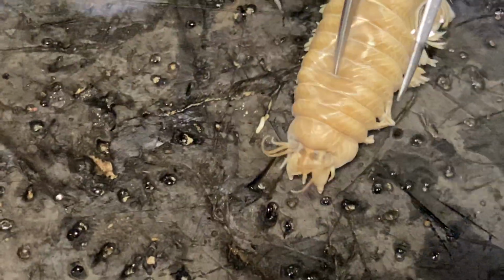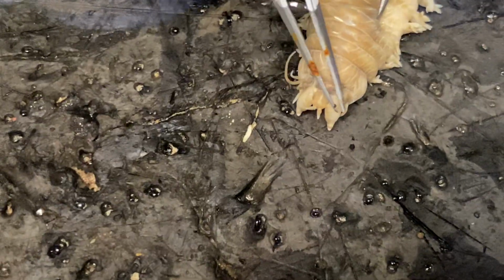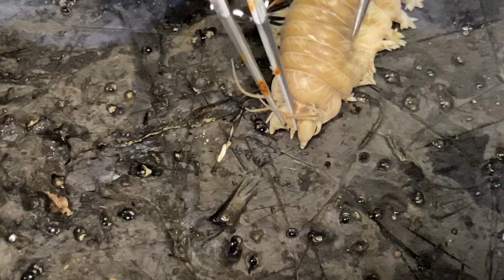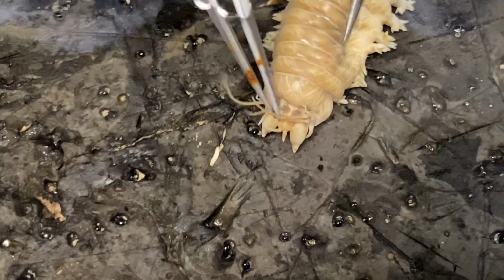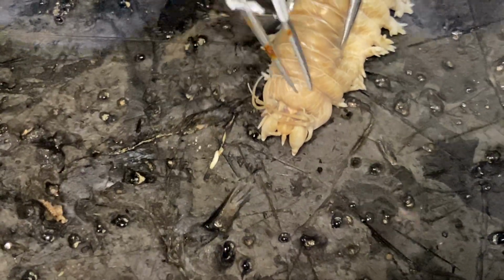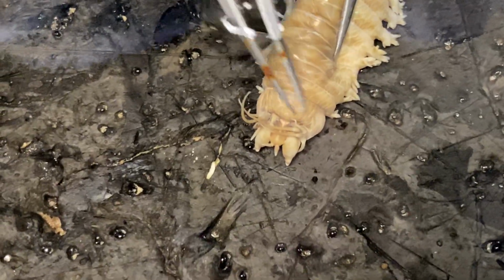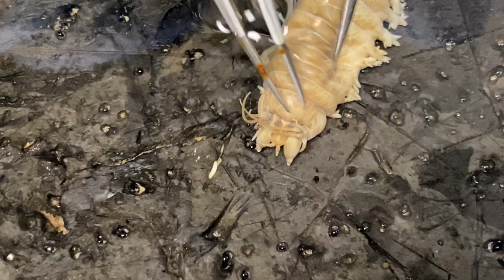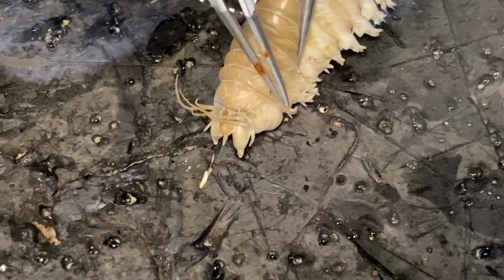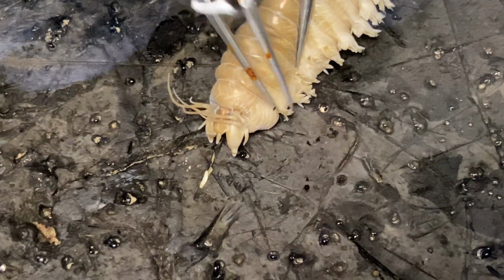So again, to just cover what we have from the prostomium: eyes on top of the prostomium, this triangular or kind of geometric shape with antennae coming up the front, palps on either side, and then tentacular cirri coming from here. This segment here that doesn't have parapodia associated with it is the peristomium. And then this next segment down would be your first chaetiger, as it has parapodia and chaetae associated with it.